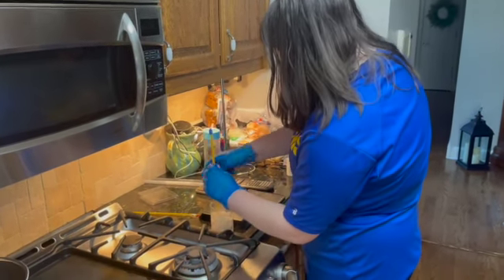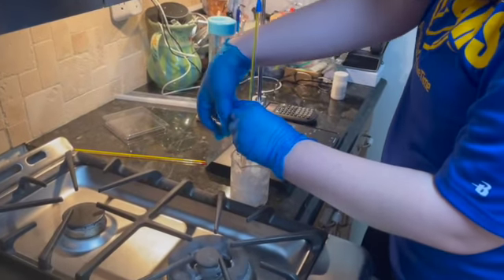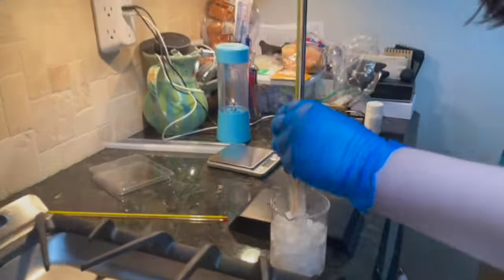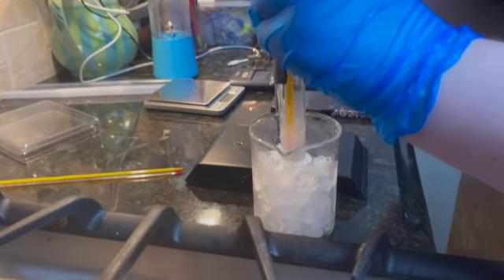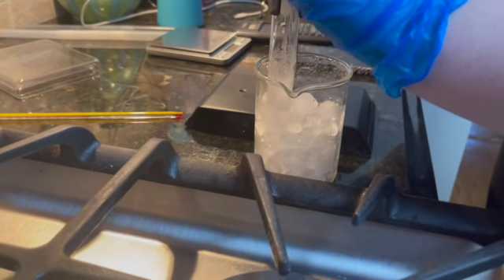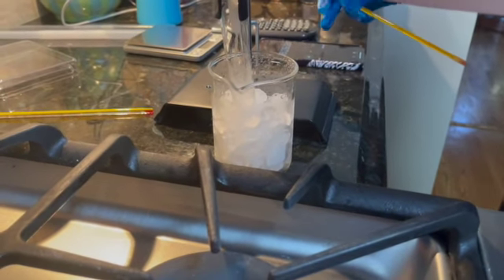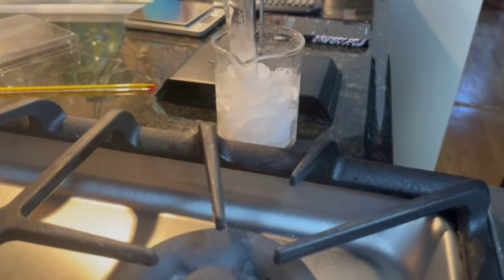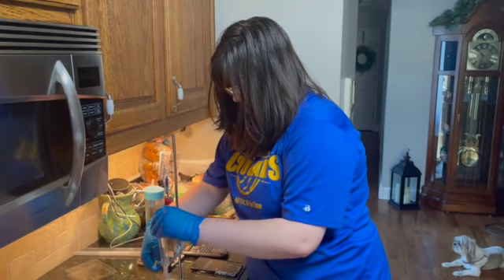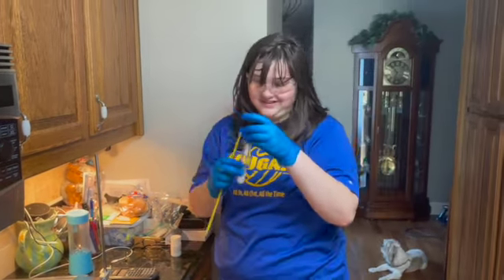It looks almost completely solid, so I'm going to pull it up just a little bit to make sure. It looks completely solid at the 5-minute mark. Let me take a check. At 5 minutes and 30 seconds, it has completely become solid again. Yeah, it's completely solid. You can stop recording, sorry.